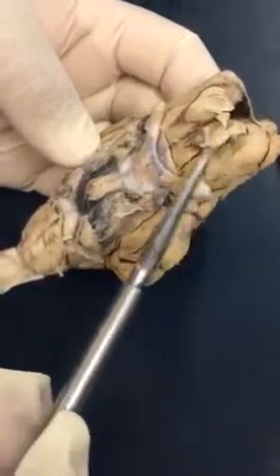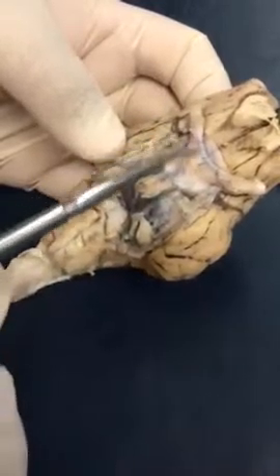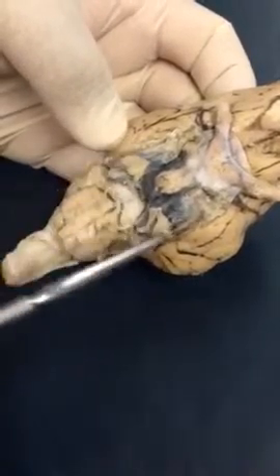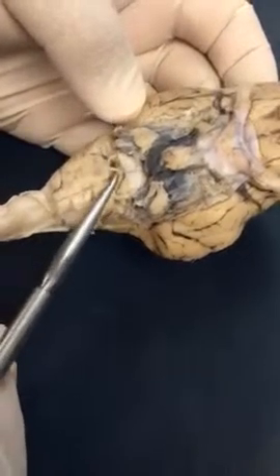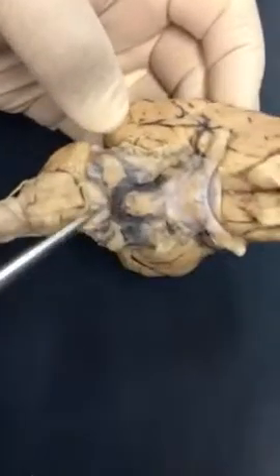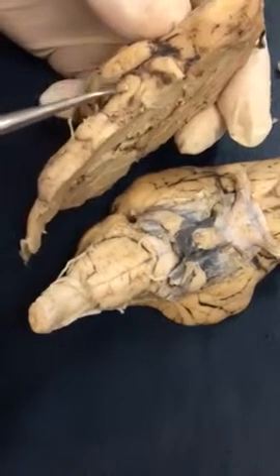As far as cranial nerves, you have your olfactory bulb, which is cranial nerve number 1, the optic nerve, which is cranial nerve number 2, and where they come together is the optic chiasma. Here's the pituitary gland in the center. Lateral to that, you have your trigeminal nerves. These are the abducens nerves here. Here is your accessory nerve. And not visible here, but possibly visible here, is your oculomotor.